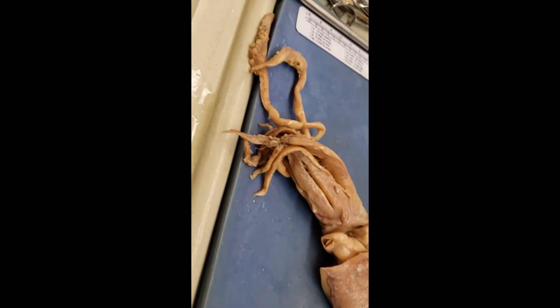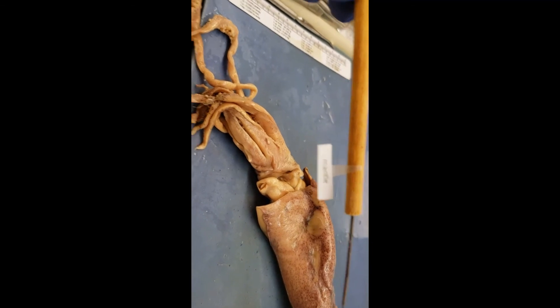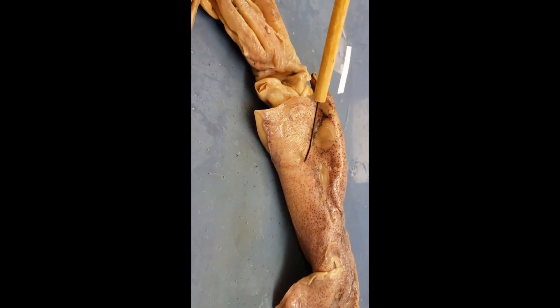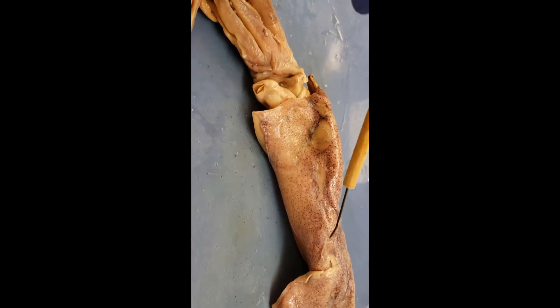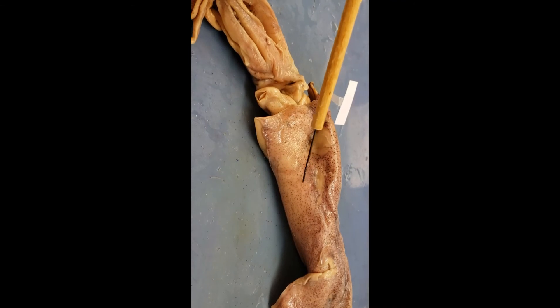The mantle is a pretty big structure amongst mollusks — same here too. You can see the mantle here. This is the mantle — it's covering part of the organism.